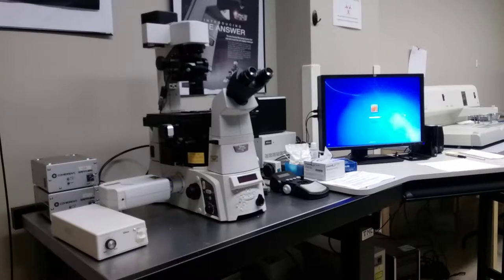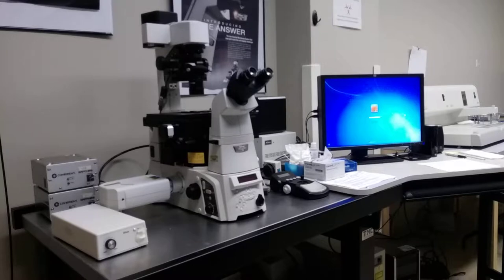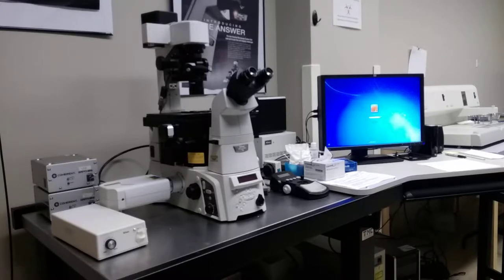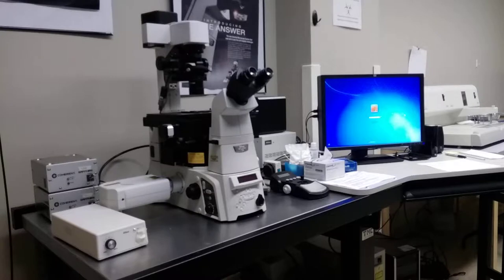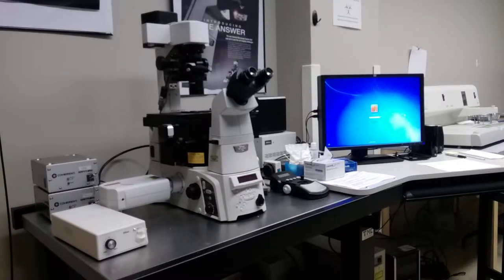Hi. I'm going to show you how to turn on the Nikon Confocal Microscope here in SCIF. As you can see, the computer is already turned on. What I'm going to show you is just the simple steps on turning on the microscope before you start imaging.